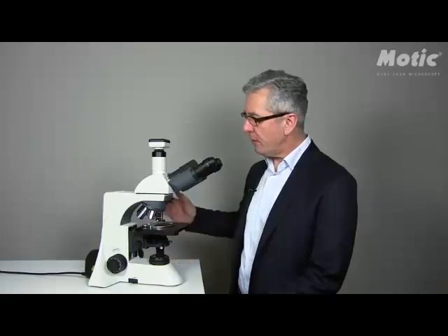Hello, my name is Dr. Hans-Jürgen Clemens from Motic Europe, and in this video I'd like to show you how to do the proper Köhler setup on our BA410 model. This explanation will be valid also for the BA310, 310 Elite and the respective Elite model from BA410.